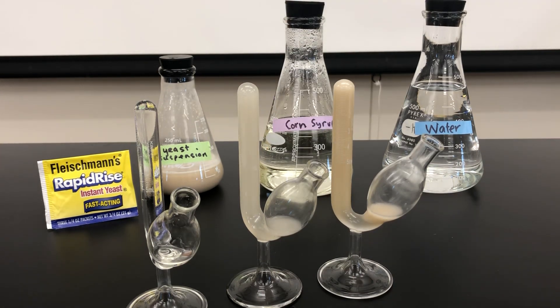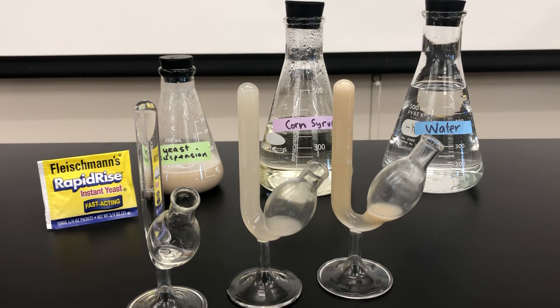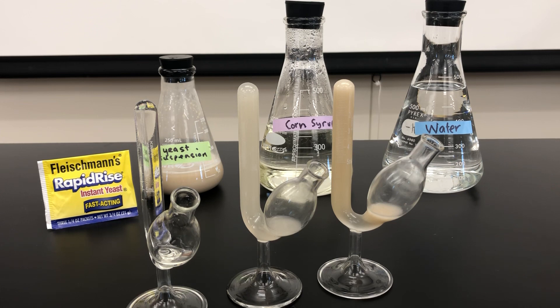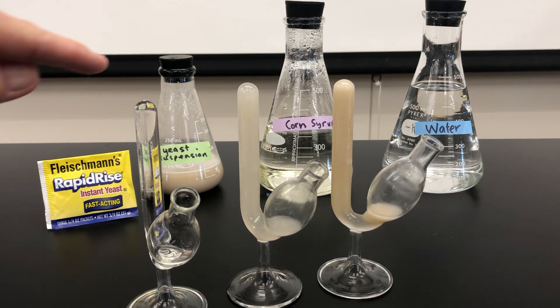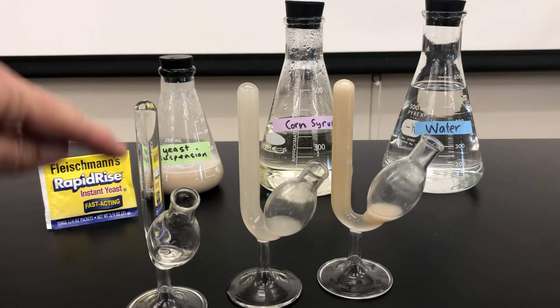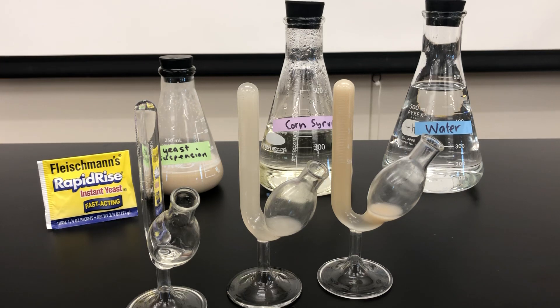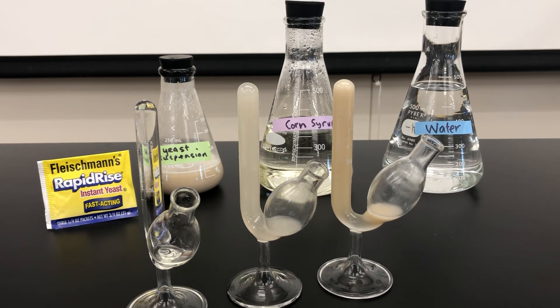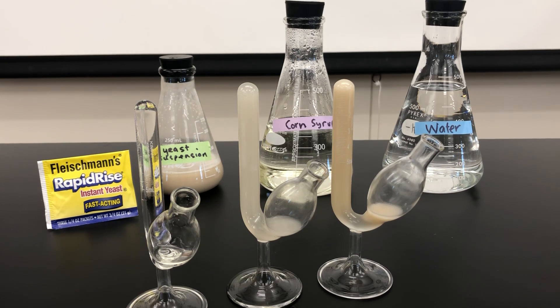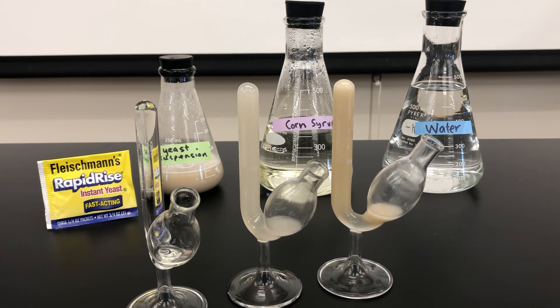Now we'll let these sit. This is time zero. Note that we have zero in the graduated stem side — no bubbles of carbon dioxide. We'll check back in five minutes.